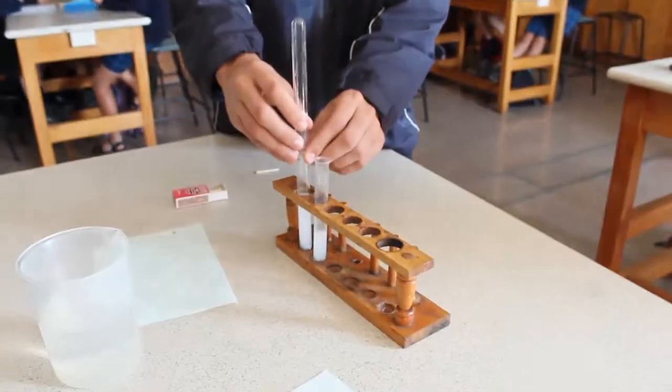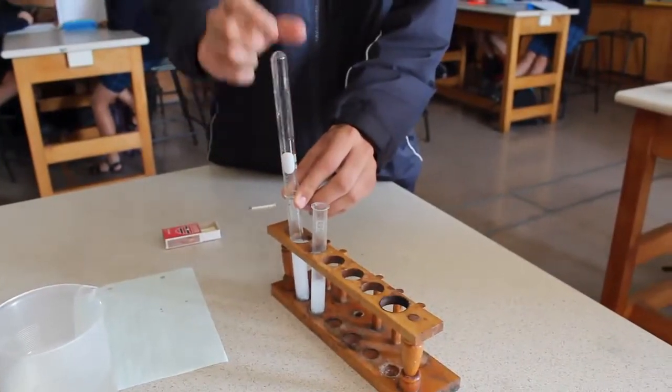Hydrogen gas is lighter than air, so it floats to the top and will be collected inside this test tube.